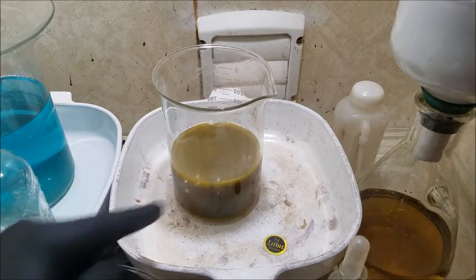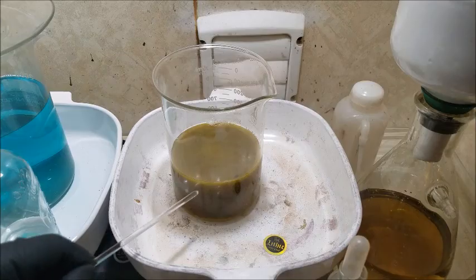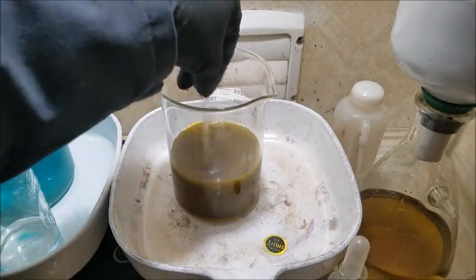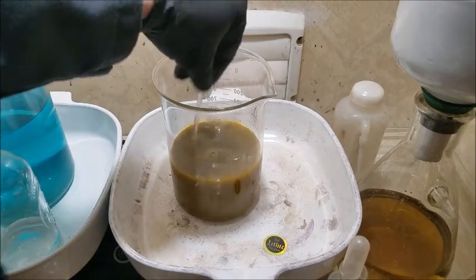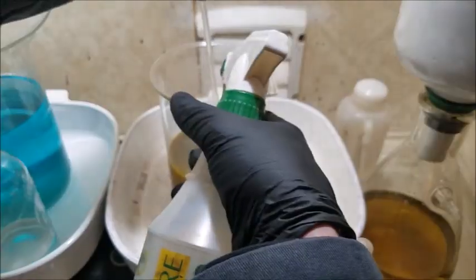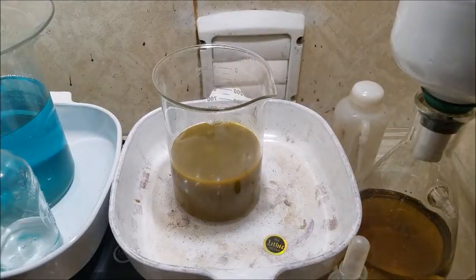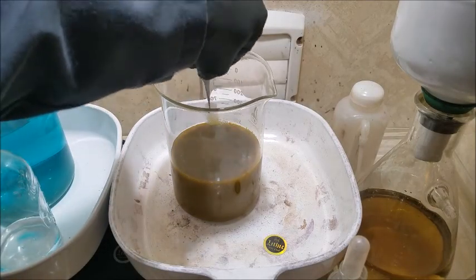Temperature change or the distilled water, it's either forming a new precipitant or it just pushed the stuff down to the clean spot. Stir it up a little bit here. Definitely yellow, probably mostly rust of sorts. At this point I honestly couldn't say. Let's get us a sample.